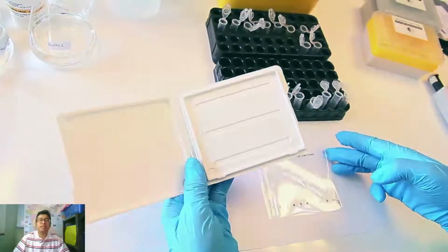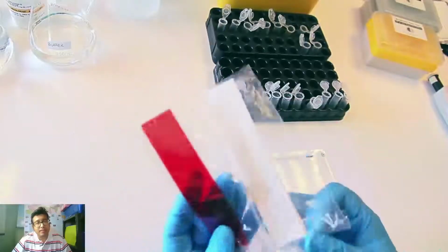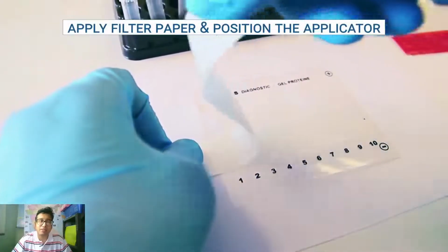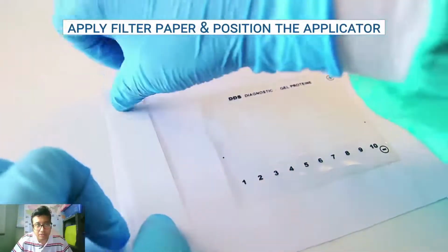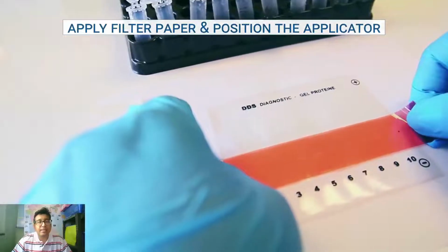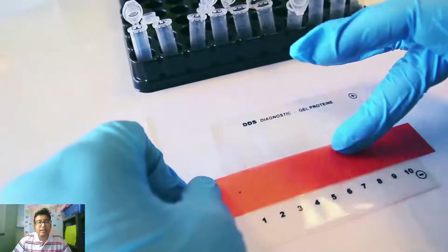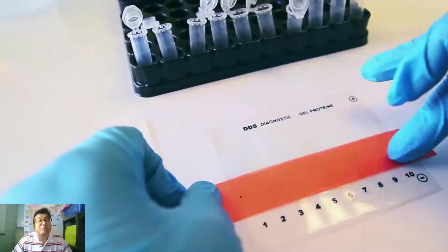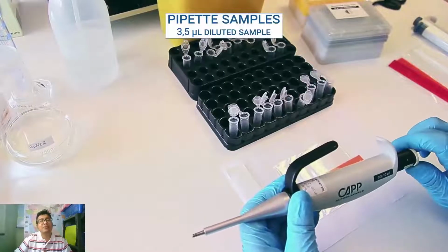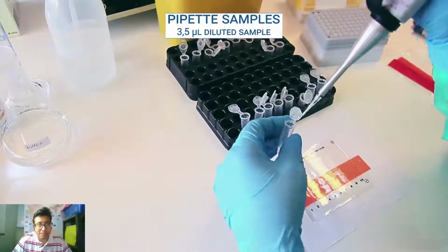So over here, see, they have already prepared the gel, or they are using a commercial gel. In this case, it is already commercially available. So what they are doing is they are using the instructions as per the kit. There is a specific, colored sticker, okay, that will help us to identify where we are applying the samples.